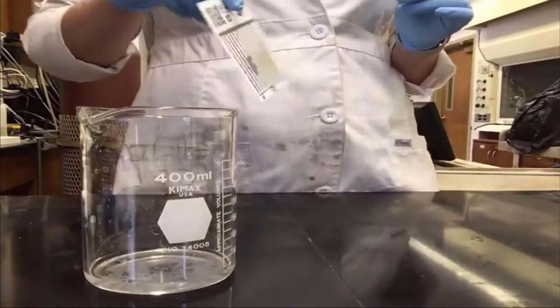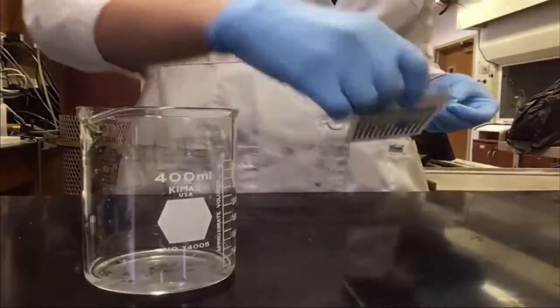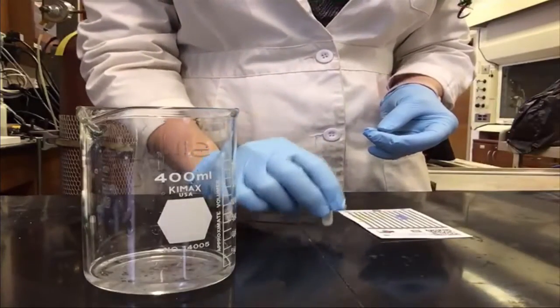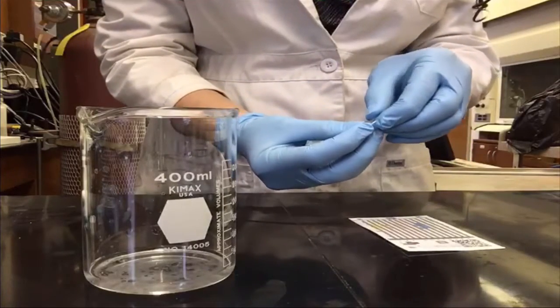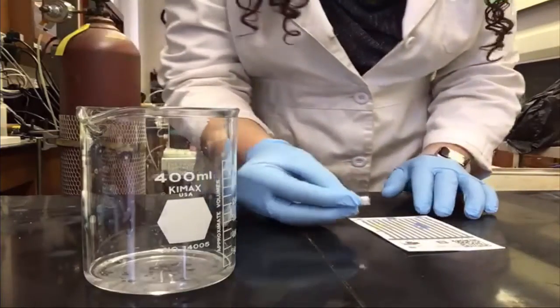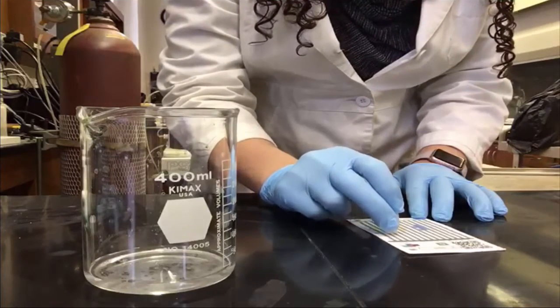In the next part of the lab, you will be assigned a drug. The pad you will use for this part of the lab will already have chemicals loaded onto it, and it will have lanes labeled A through L. Some of these lanes contain the test that you just used in the previous experiment. There is a very small amount of powder in each capsule. Make sure you tap all of the powder down to one side before you open the capsule. Carefully open the capsule and tap the powder onto the pad along the swipe lane. Get as much of the powder onto the pad as you can. Be very careful not to spill any of the powder onto the bench top.